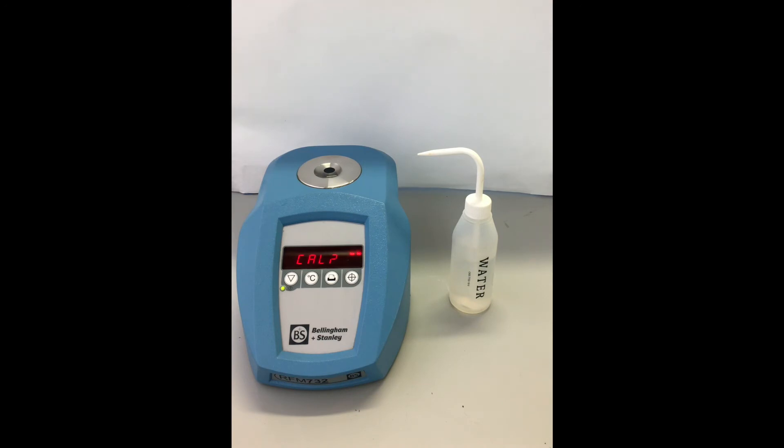Then press the key again and the display will eventually show 0.0. To go back, press the power/read key. If the calibration has worked, the display will show this number.